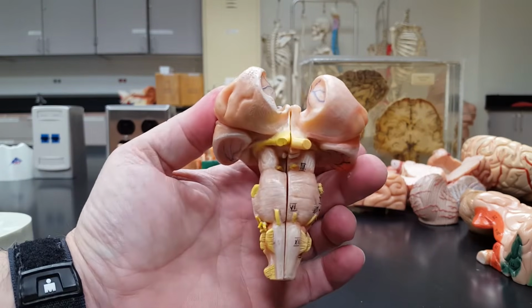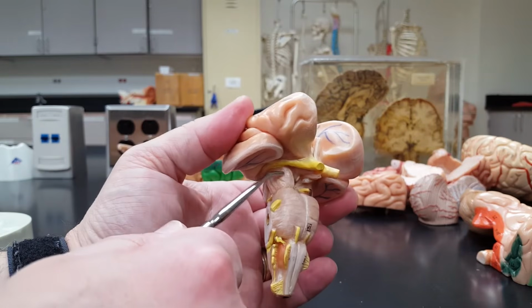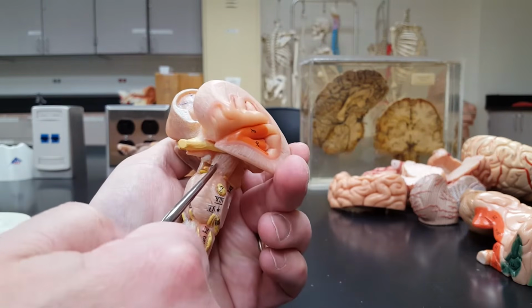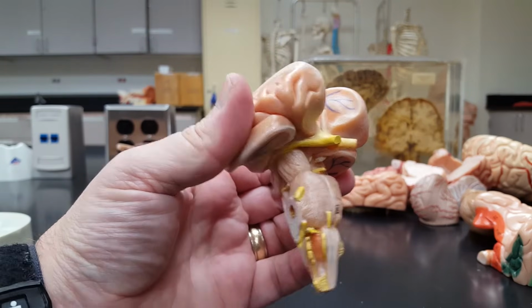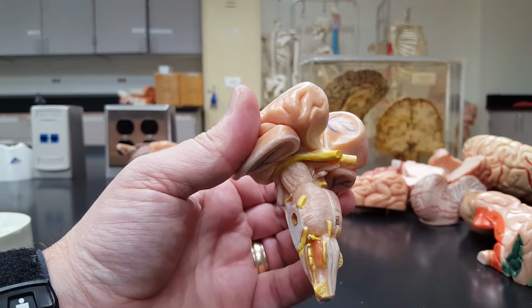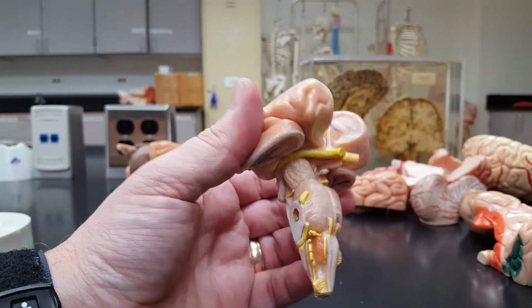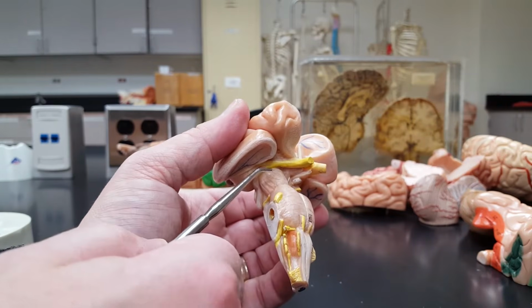And if I put this brainstem back together, I want you to notice right here and right here. Structures that look like great big giant cables, bundles of wiring. And that's only because they are giant cables, bundles of wiring, the wires here being axons.